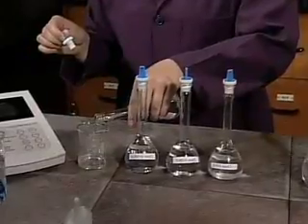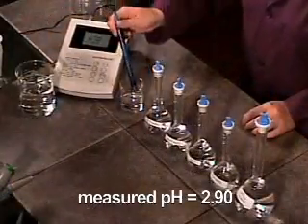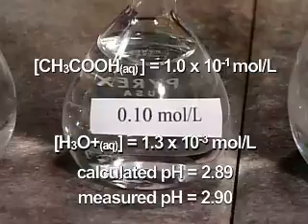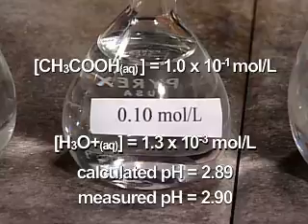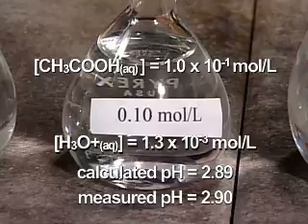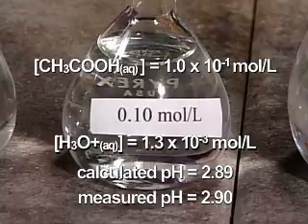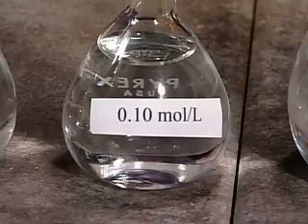The solution is poured into a beaker. The pH is measured and found to be 2.90. Weak acids do not ionize completely. A solution of 0.10 mole per liter ethanoic acid is only 1.3% ionized. The concentration of hydronium ion in a 0.10 mole per liter solution is 1.3 times 10 to the negative 3 mole per liter.